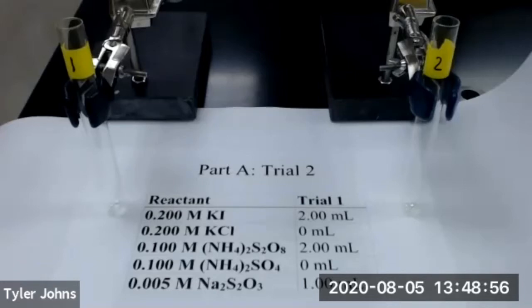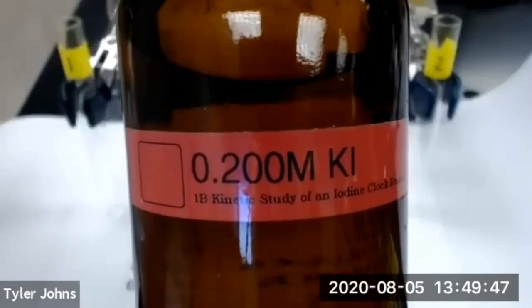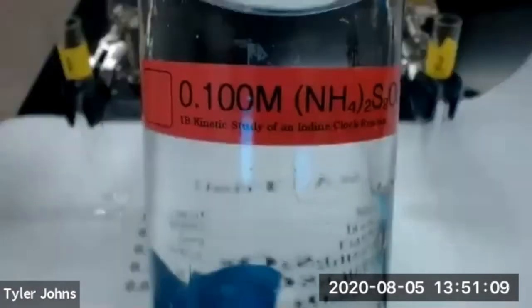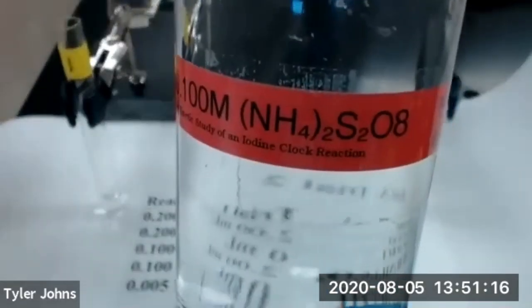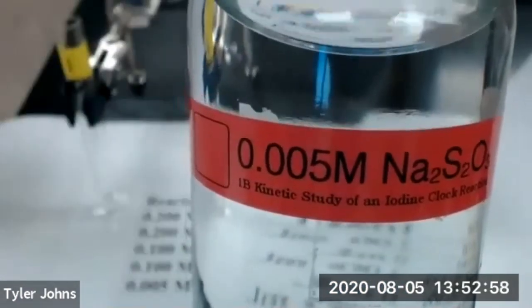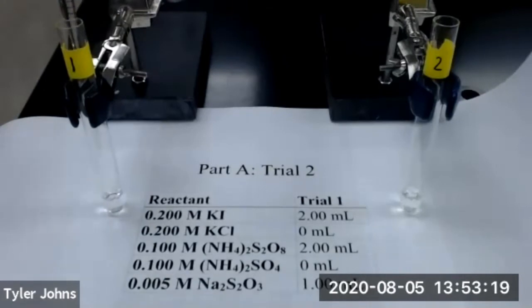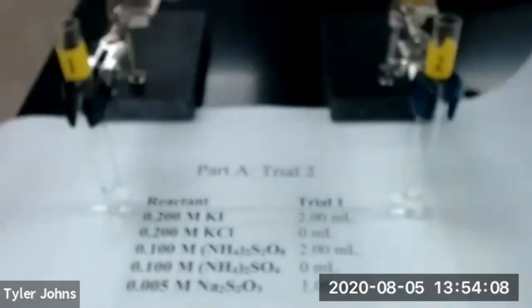We'll now prepare our test tubes for trial number two. We'll first add 2.00 milliliters of 0.200 molar potassium iodide to test tube number one. We'll now add 2.00 milliliters of 0.100 molar ammonium persulfate to test tube number two. We'll next add 1.00 milliliters of 0.005 molar sodium thiosulfate to test tube number one. We'll now add 2 drops of 1% starch indicator to test tube number one.